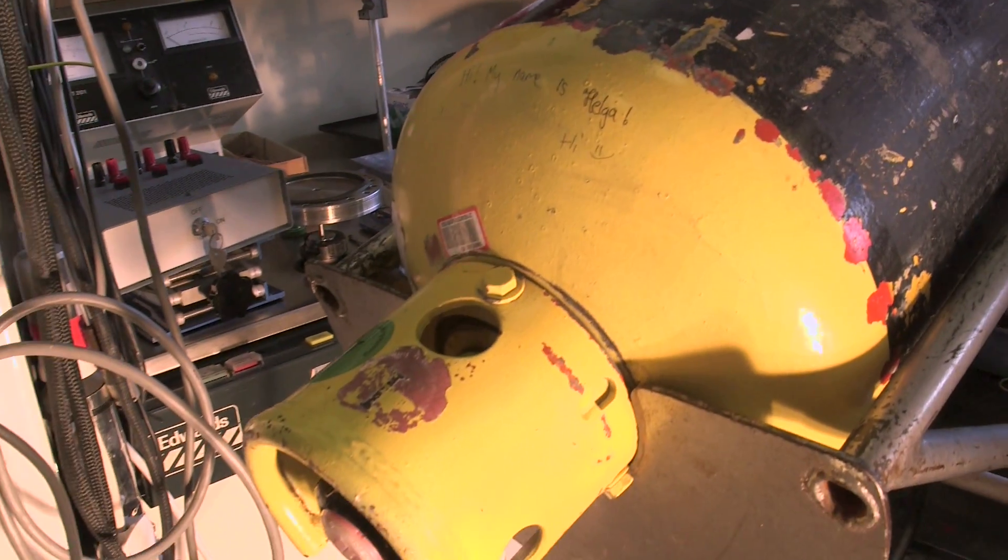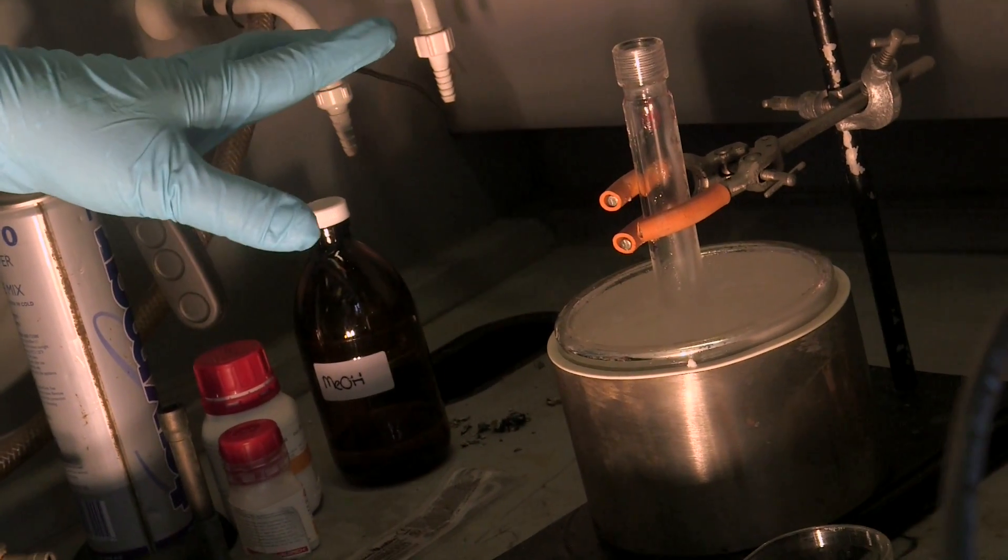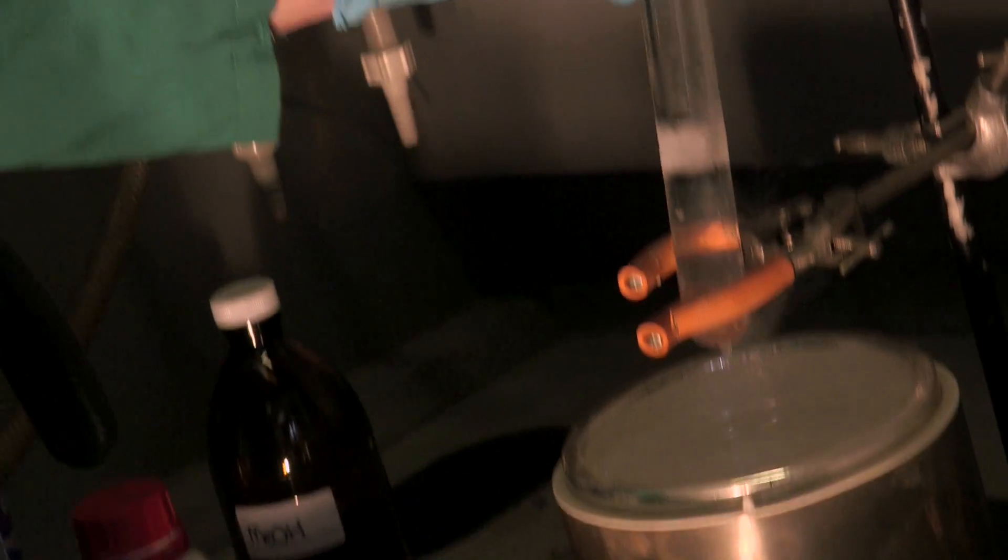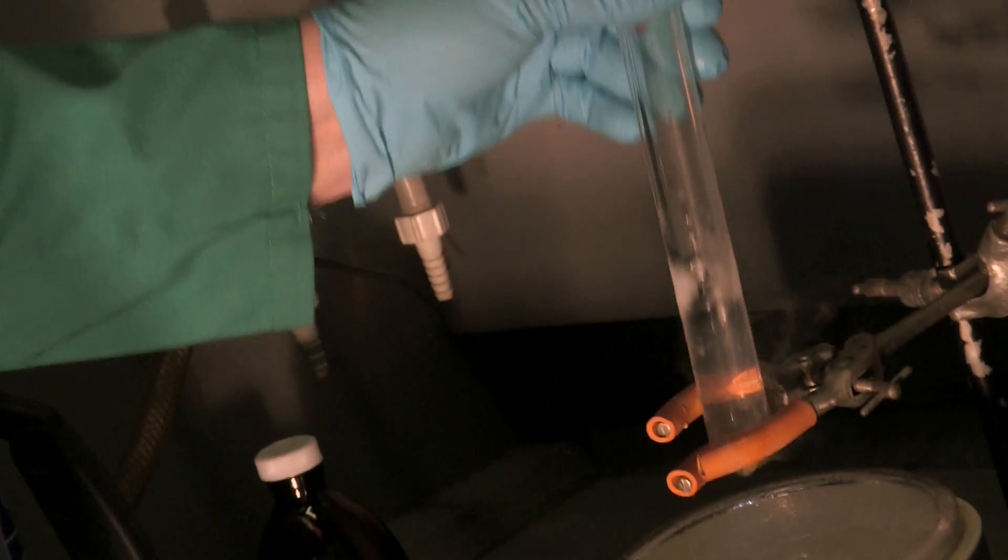So that brings the whole temperature down to about minus 78, and we need to do that because ammonia boils at minus 33 degrees. We've got ammonia in this cylinder over here. We've just condensed some of that into this sealed tube, which currently is not sealed, but we're using this because it's got nice thick glass.